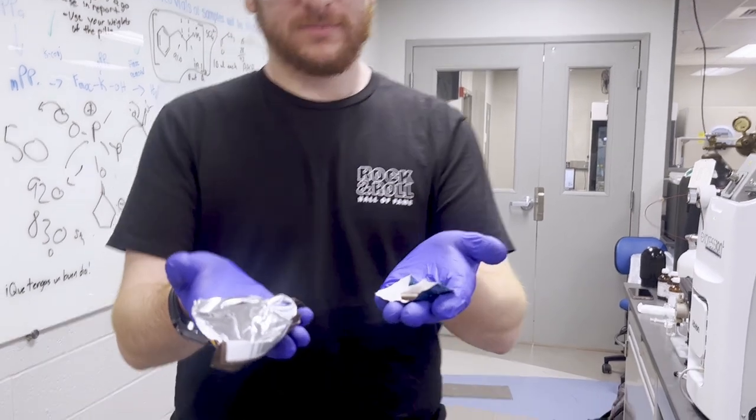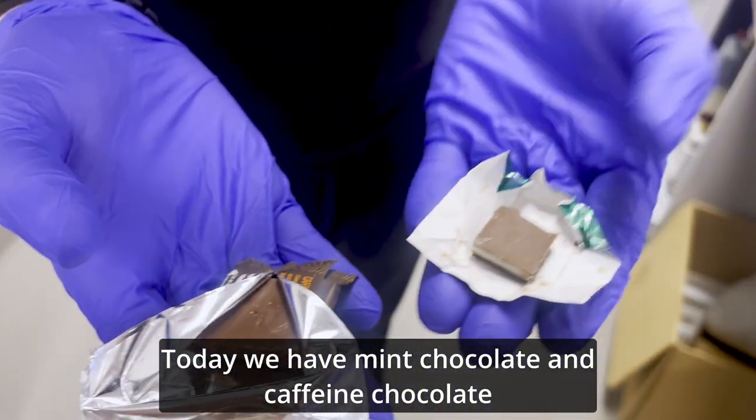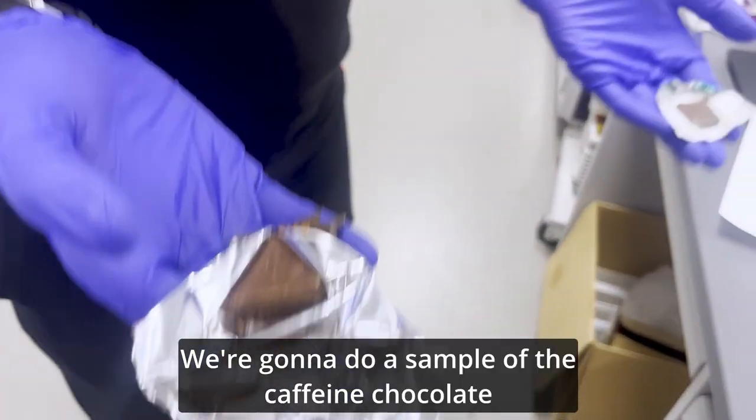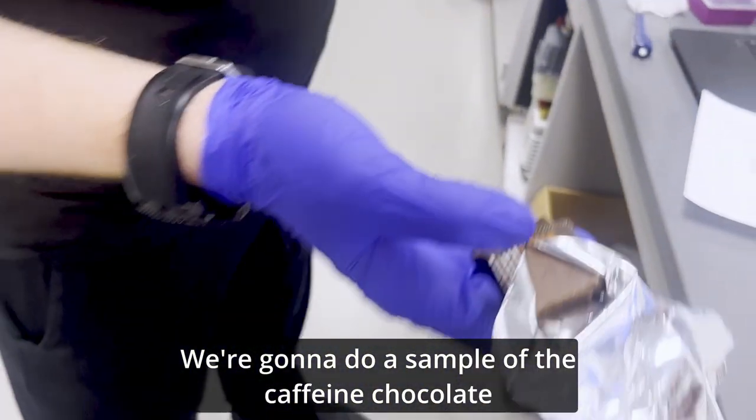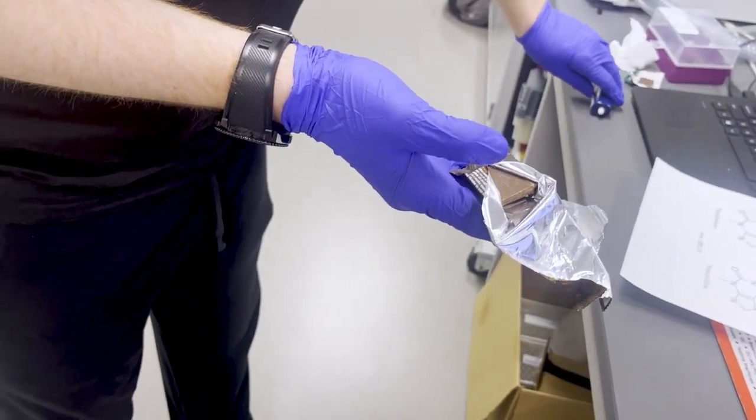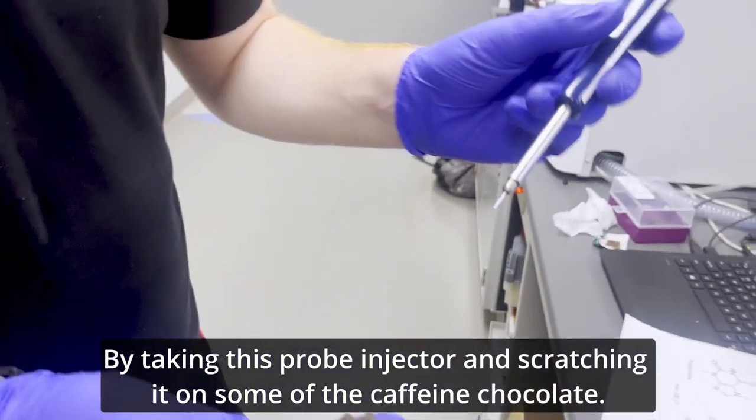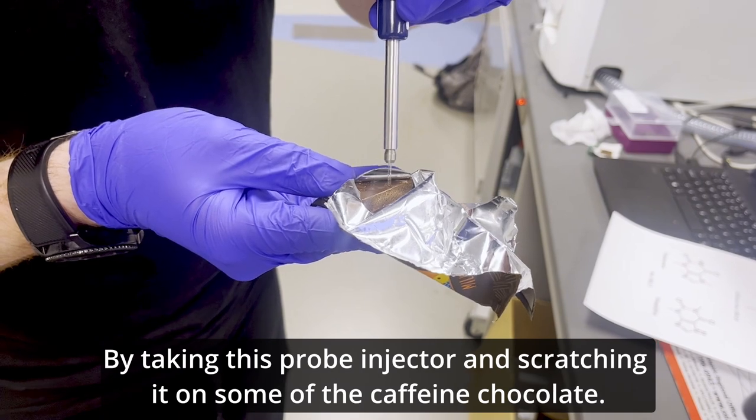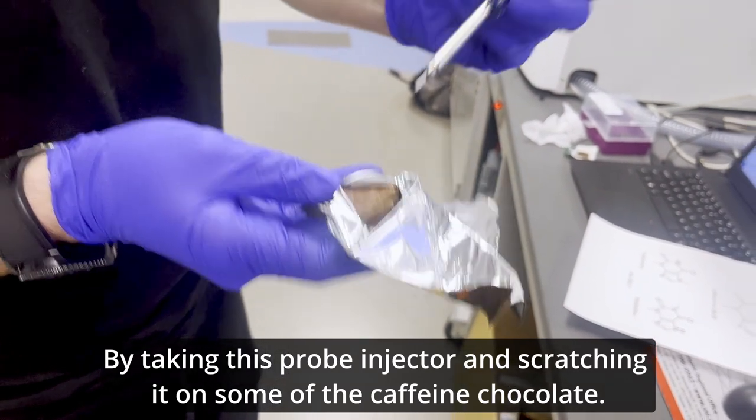Hello, come closer. Today we have mint chocolate and caffeine chocolate. We're going to do a sample of the caffeine chocolate by taking this probe injector and scratching it on some of the caffeine chocolate.